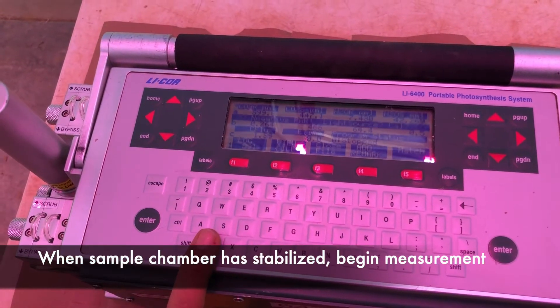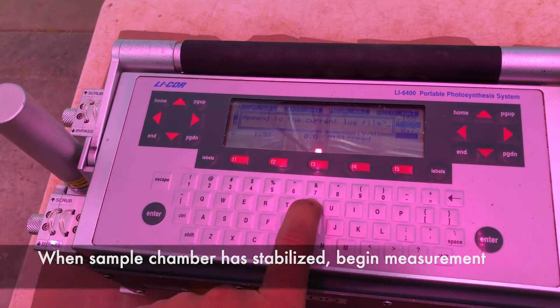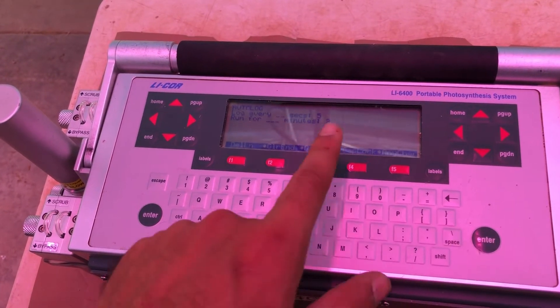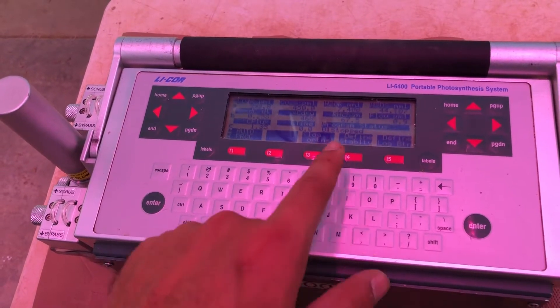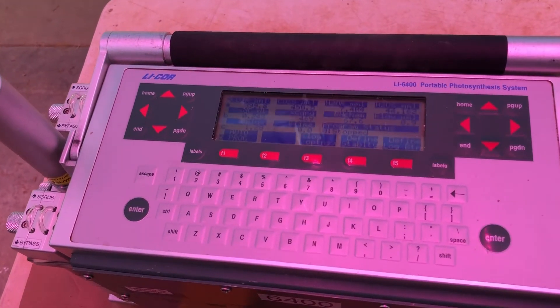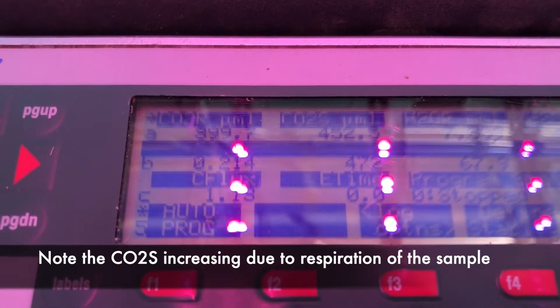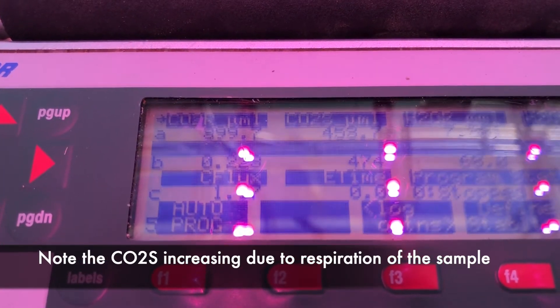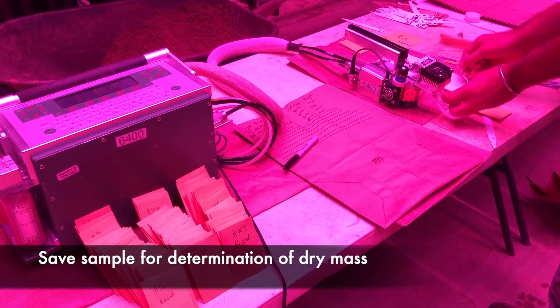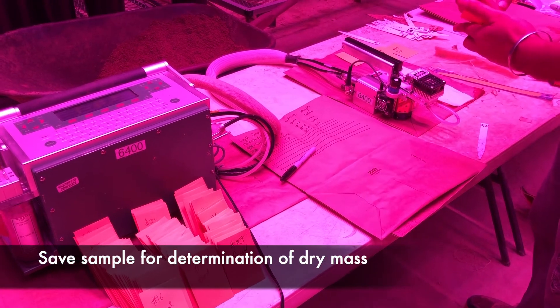In our measurement of respiration, we take a measurement of the CO2 level of the sample chamber every five seconds over a three-minute duration. We will use the change in CO2 of the sample chamber over time in our calculation of respiration. Here you can see the CO2 concentration of the sample chamber increasing as our measurement progresses. After the completion of the measurement, we save the sample for determination of dry mass, which will be essential for calculating the respiration rate per gram of root.